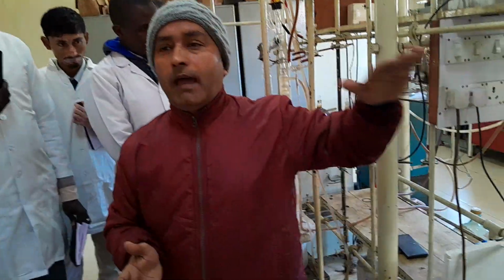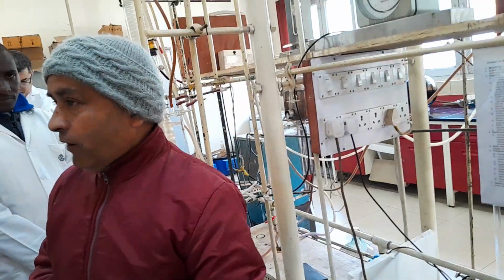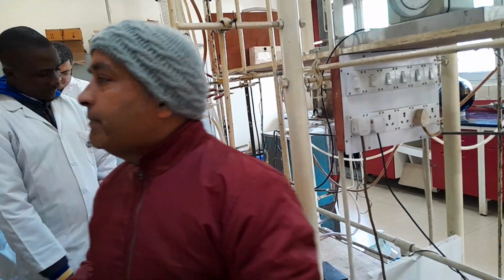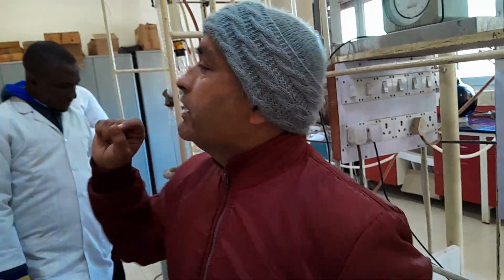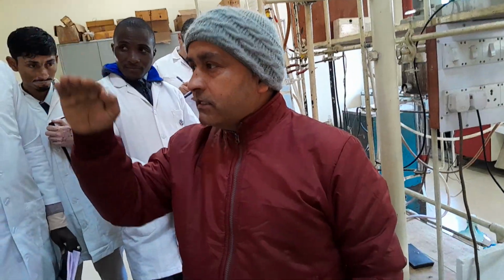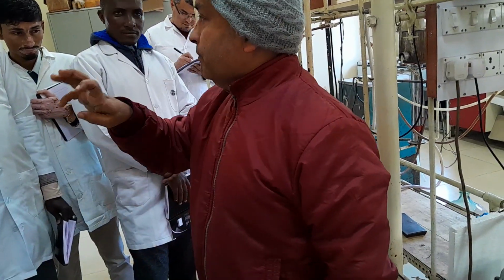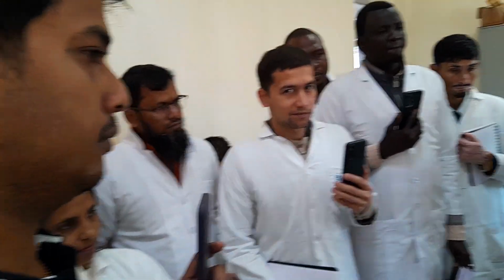So obviously the FBP will be lower because there will be a decomposition inside the flask before 140. Isn't it? So when you talk about FBP in D86, the definition is the maximum temperature at which your temperature drags down, or you can say there will be a decomposition inside the flask and your temperature suddenly drags down. So the maximum temperature reached, after which it goes down, is your FBP.